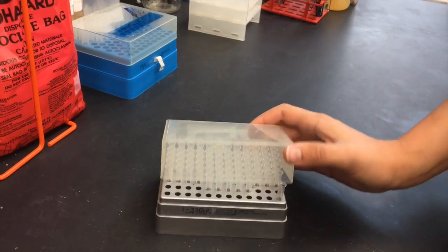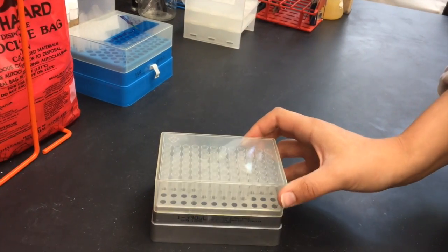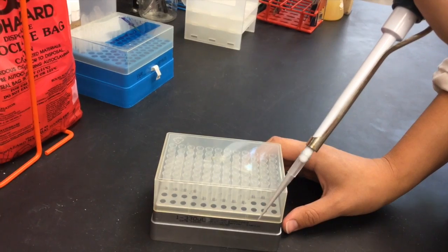Remember, you must change tips in between drawing individual solutions in order to avoid mixing or contaminating the solutions used.